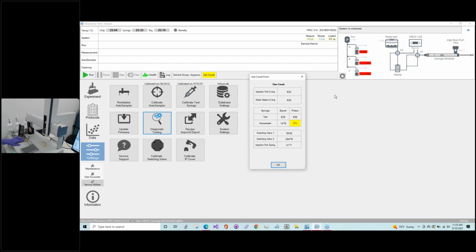And just another aside, Marina had mentioned that when she comes in to get a test going, she'll look to see if there's any flooding behind the test syringe. Because sometimes when these start to get old and the piston is loose in the barrel, we can have excess fluid coming out during the backside cleaning portion of the cleaning protocol. And you can see some flooding back here. So that's another indicator for getting things swapped out.